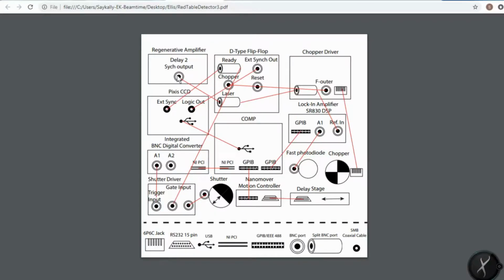The next thing I want to show you is how we use pyFSRS to control our instrument, which is an ultra-fast laser detector. The laser gives a signal from a regenerative amplifier. The signal is a 5-volt TTL signal at 1 kHz. The signal from the regenerative amplifier is handled by a D-type flip-flop circuit. The D-type flip-flop handles the logic from the chopper driver and the regen to synchronize the Pixis CCD so that it triggers with the correct phase with respect to the set and reset signals.